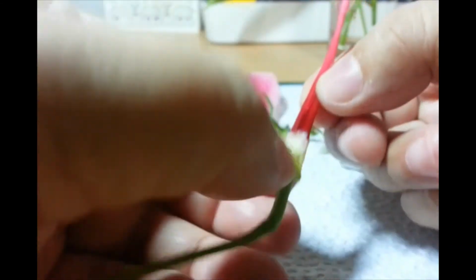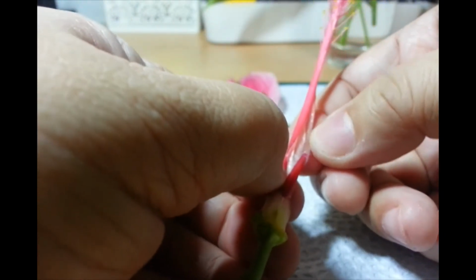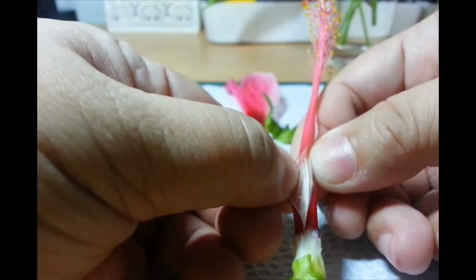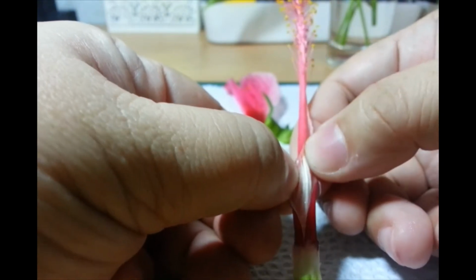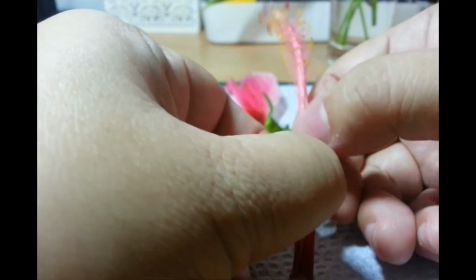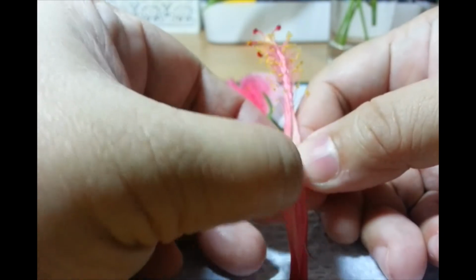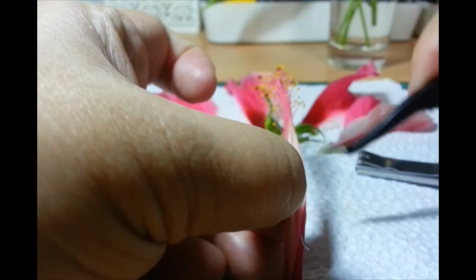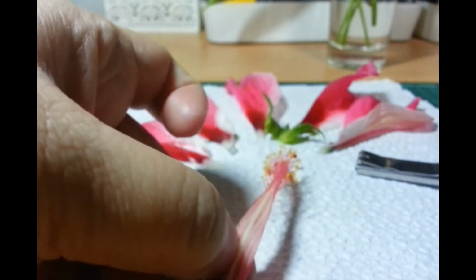Okay. Oh. Still intact. Okay. Sorry. Off camera ba? Ayun. You see that white thing? Sorry. Nakaharang pala yung aking thumb. So that white stalk in there is part of the female reproductive parts. There. Nice. Okay. I haven't done this in a while. I'm so happy na hindi ko siya nasira. Okay. So, there's a tube here. Inside. Okay. So, we'll just continue cutting.